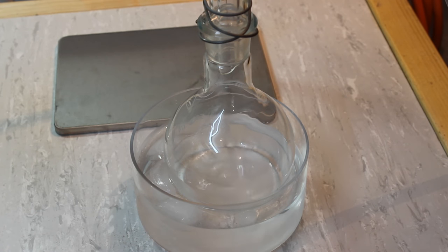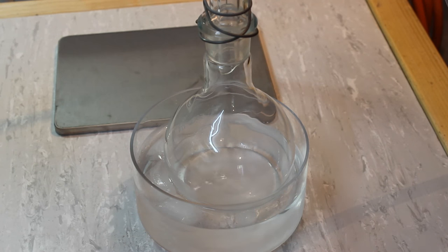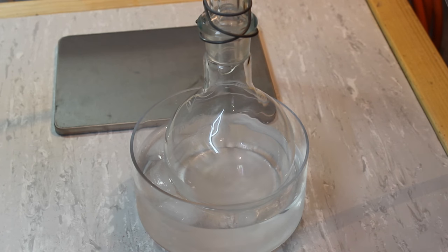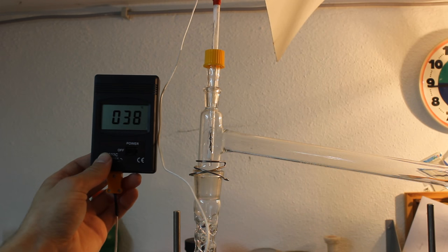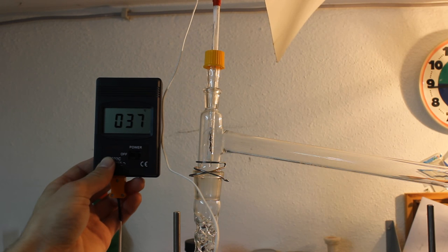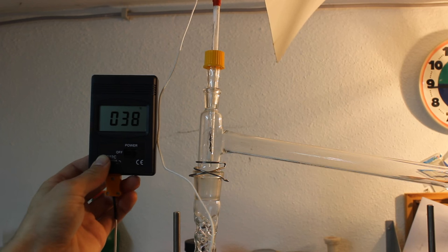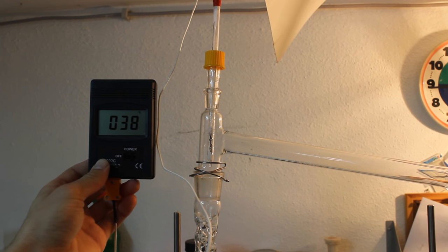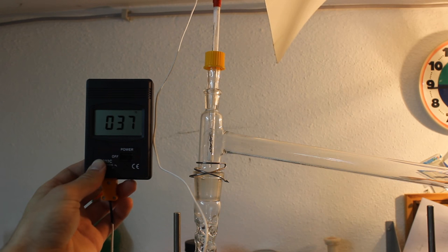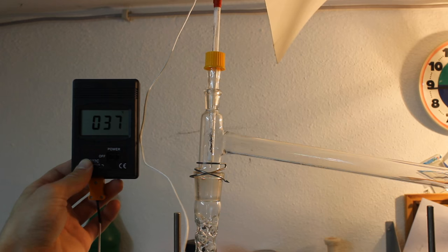Here is our collection flask where we are currently collecting our bromoethane. The procedure calls for 2-3 drops of distillate per second, so I guess we should be alright. The still head temperature is currently reading a nice constant 37-38 degrees Celsius, which corresponds very well to the theoretical boiling point of 38°C. But bear in mind it is very easy to overshoot your column with liquids this low boiling, so just be patient and don't rush it.